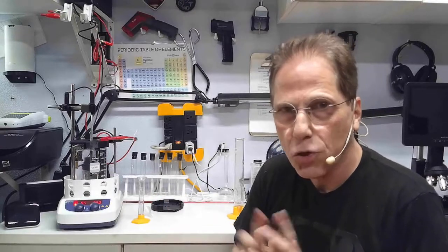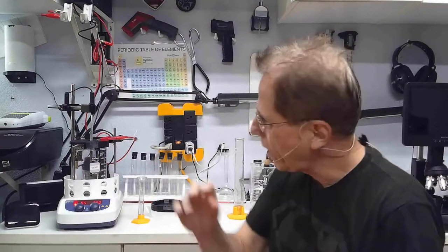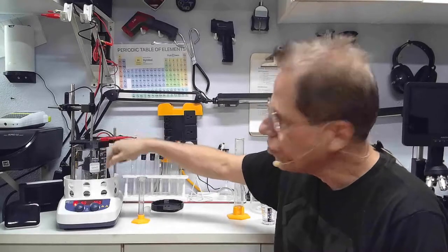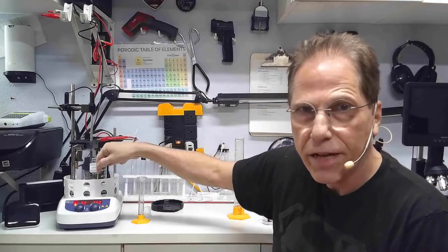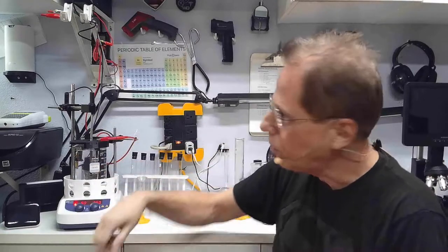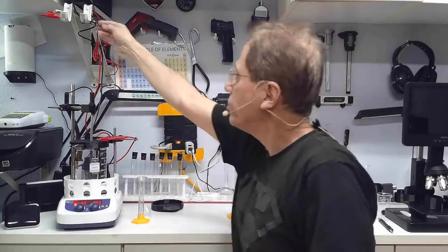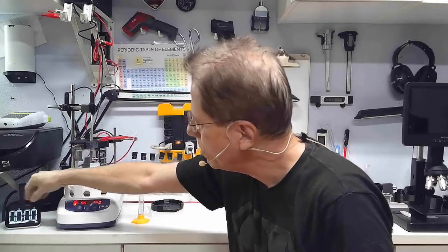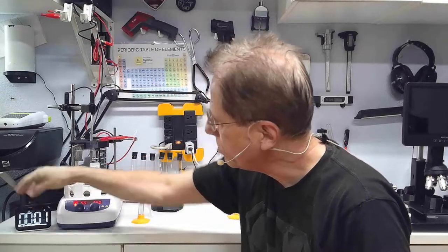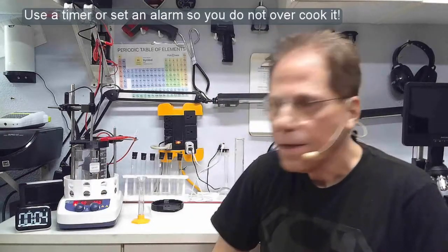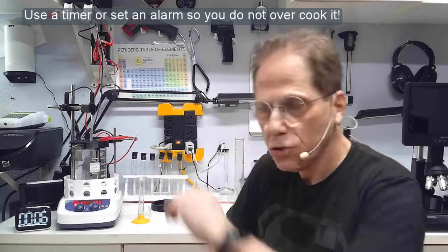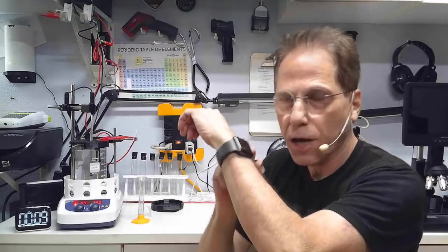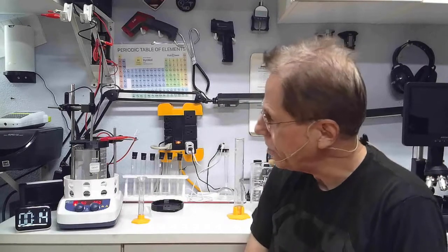That's keeping everything consistent. The only thing that could change with your amount of time is the amount of gold. The more surface area you have in contact with the liquid, the faster your gold is going to cook. I'm going to turn this on right now. I'm going to set my timer to start counting for 20 minutes. Usually, if I get busy, I will set a timer on my watch to remind me to stop the process in 20 minutes.